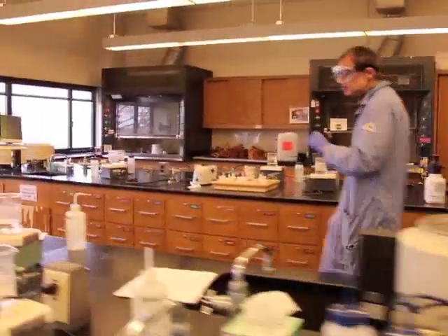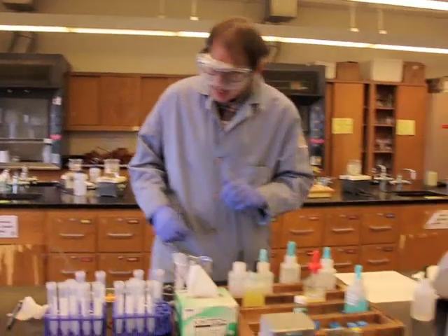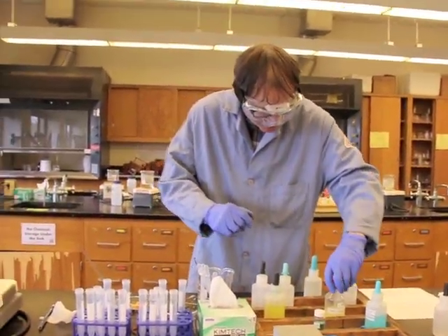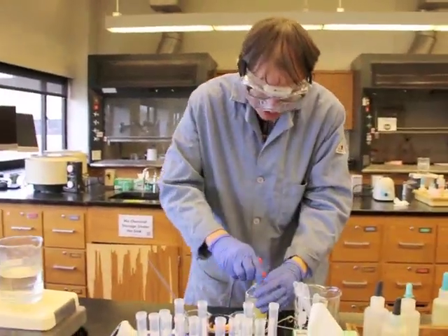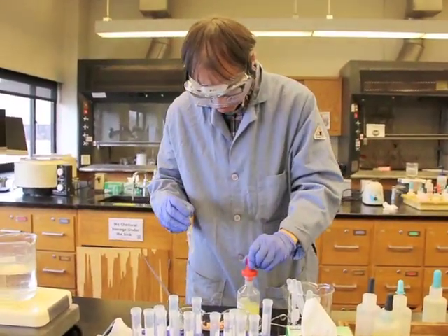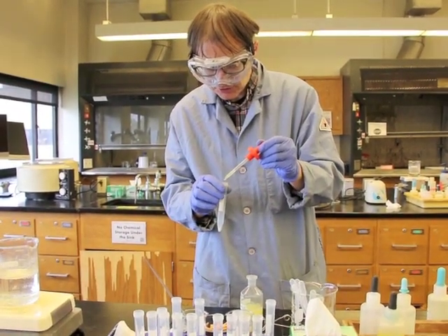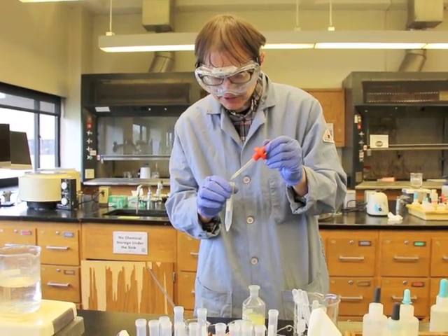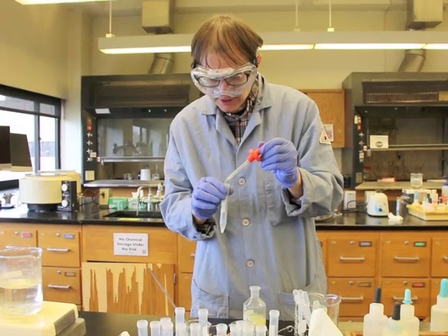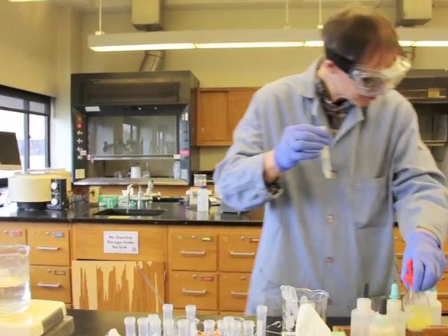So let's come over here. We're going to take a look at the chemistry. Let's look at this reaction here. What it says is to drop 10 drops of the tin chloride. So here's our tin 2 chloride. 10 drops into the precipitate. 1, 2, 3, 4, 5, 6, 7, 8, 9, and 10. Okay, there's our tin chloride.